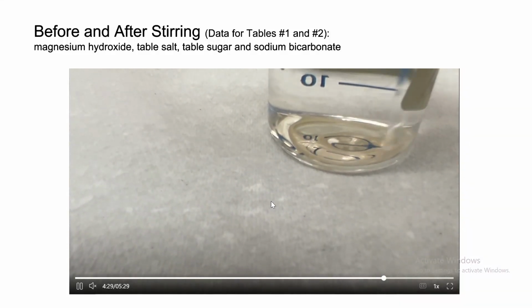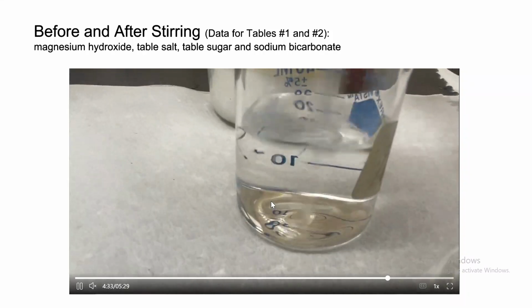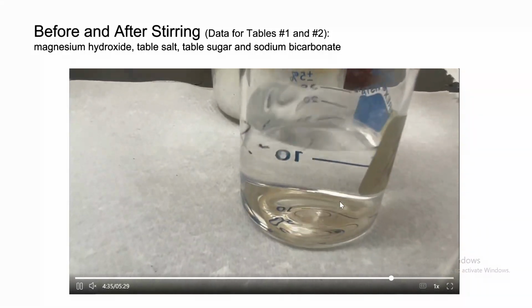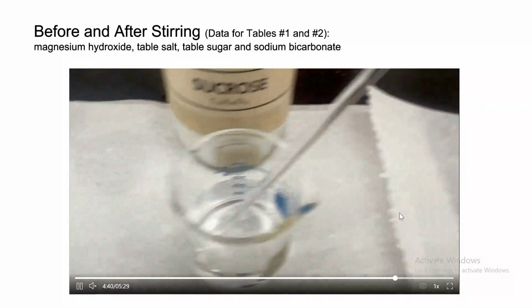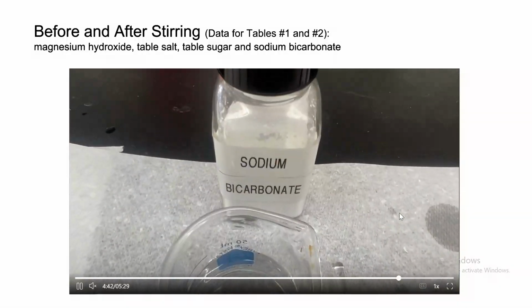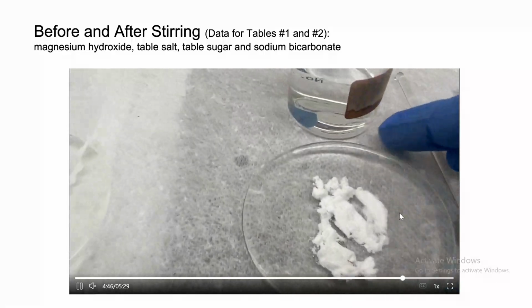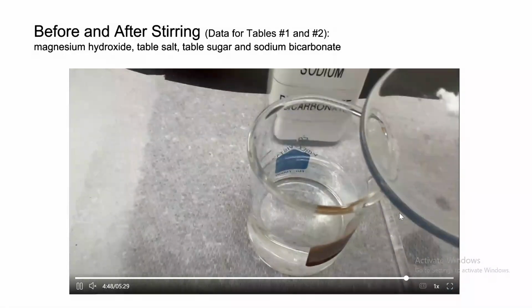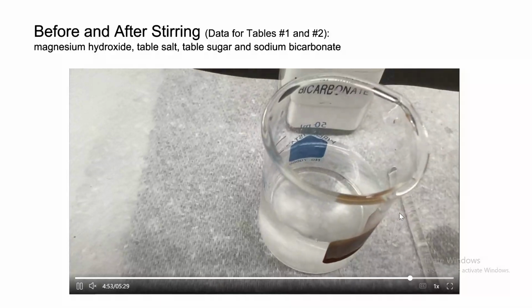Now we're going to go to the last portion. Oh, but look, see, it's mixing. The last portion is the milk of magnesia. Let's go to the milk of magnesia now, right here. No, actually, sodium bicarbonate. So now, not milk of magnesia, we're going to do sodium bicarbonate. We're going to add sodium bicarbonate to the beaker.